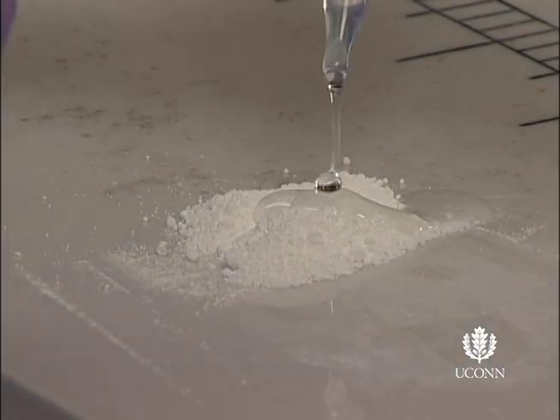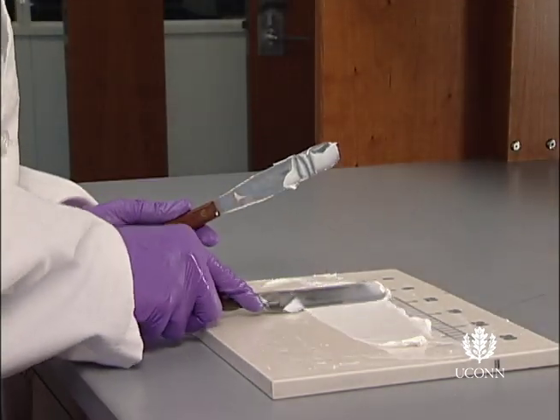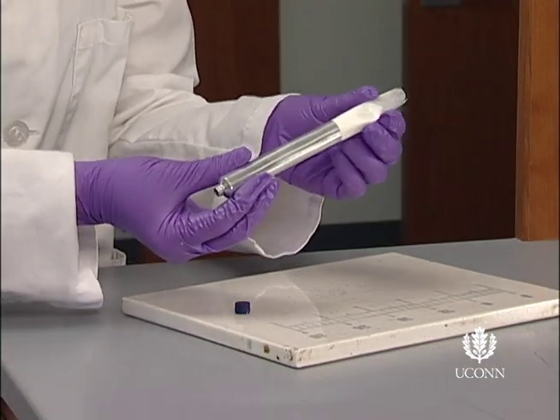In this video, we have described the techniques of levigation and shearing and the importance of both in order to create a homogeneous ointment that will be pharmaceutically elegant and acceptable for your patients.